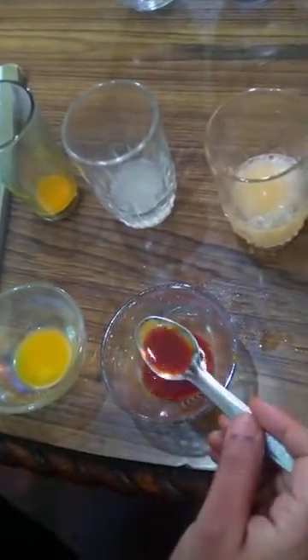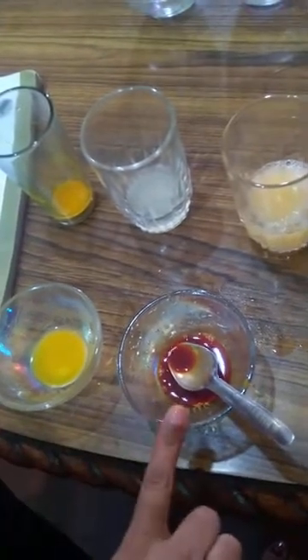Yes, soap solution we put and turmeric solution. And what is the change? You can see the color change children. It is red in color. So how turmeric can tell? So this shows that turmeric can tell this is an acid because no change is there. This is a base. Why? Because it turned red into color.